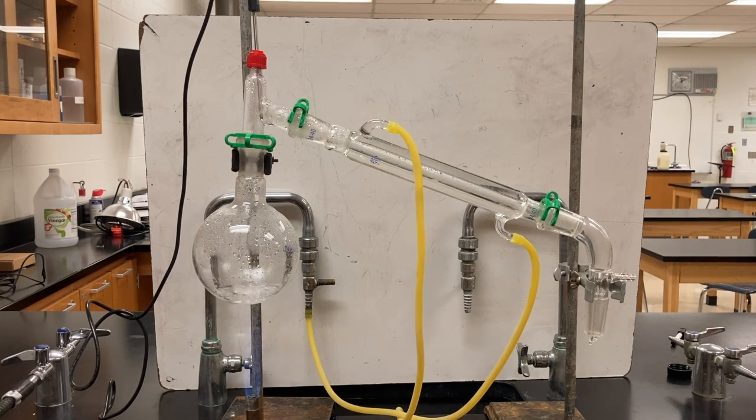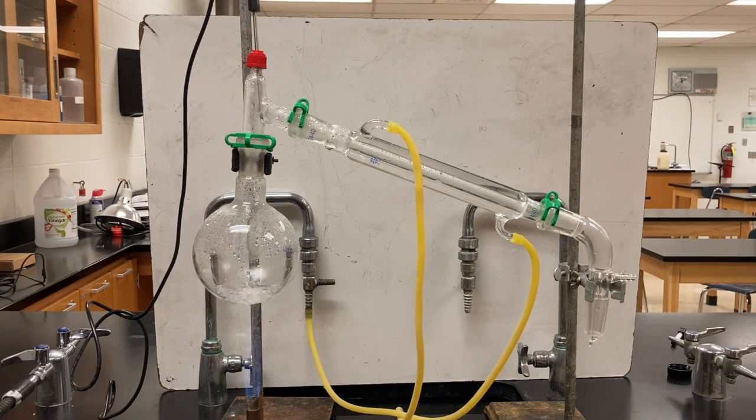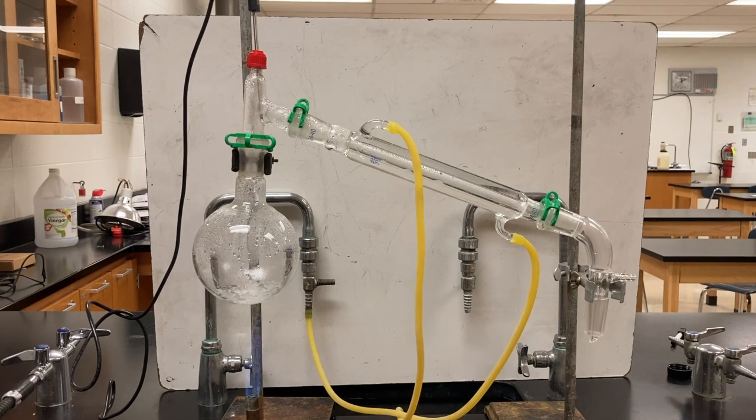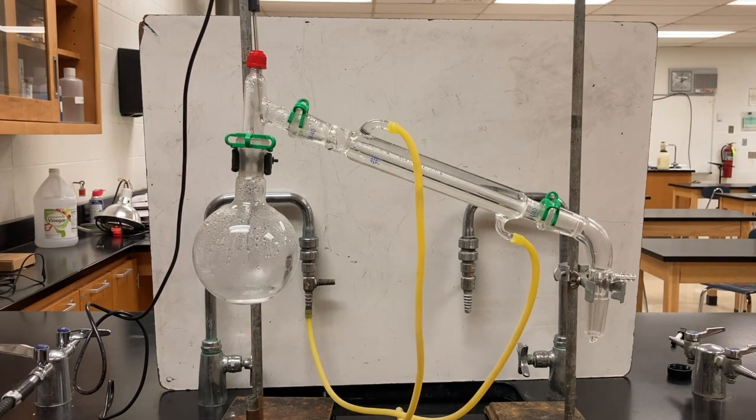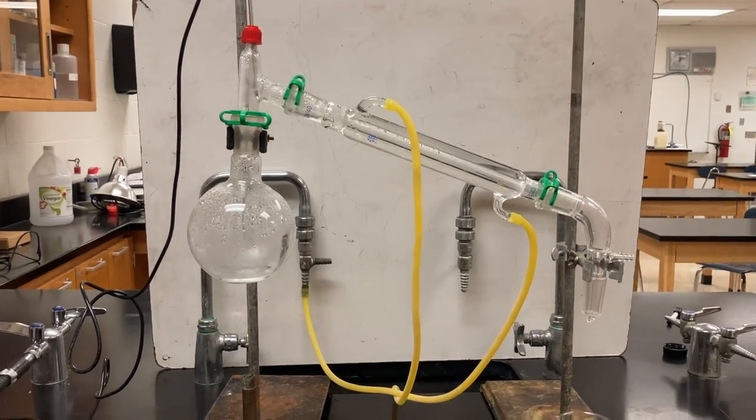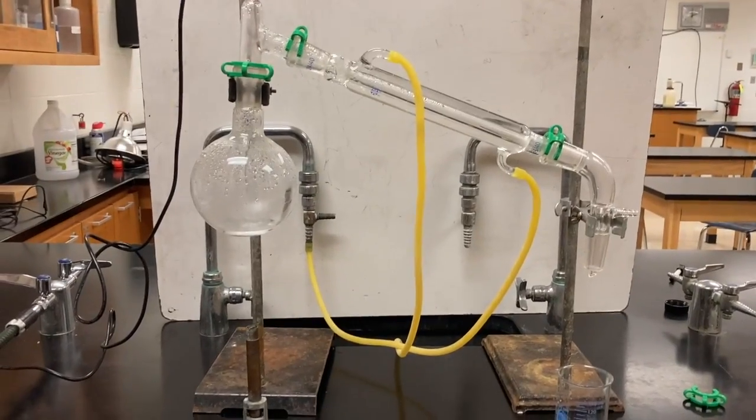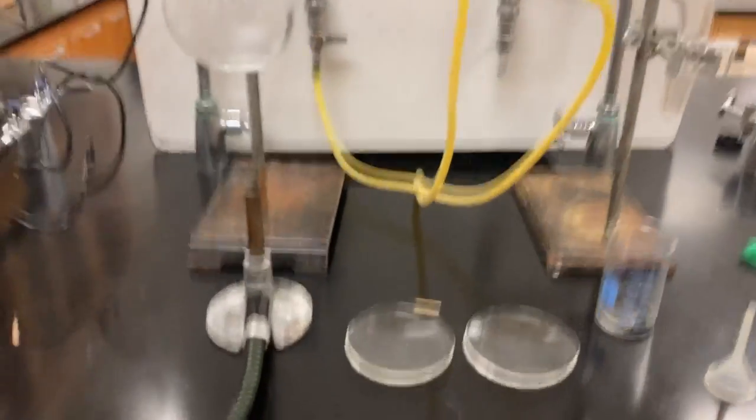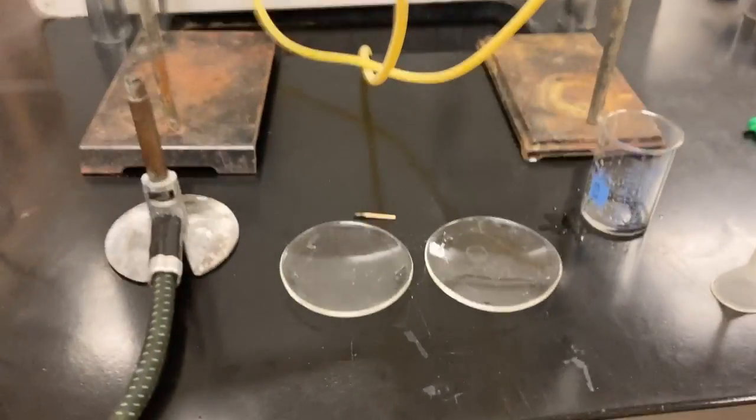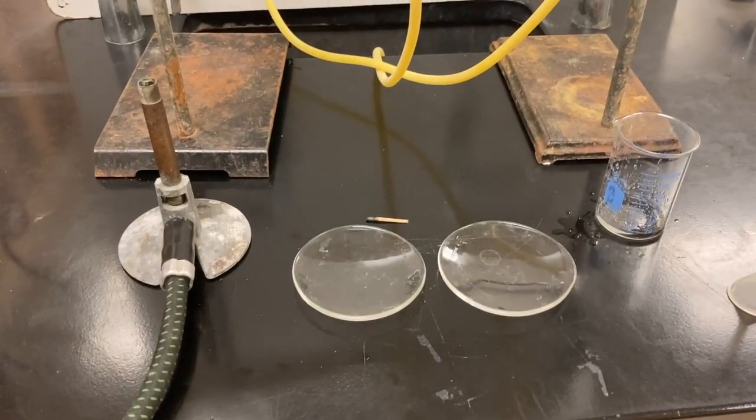We'll do a test to be sure. At this point, I'm going to stop the distillation process because I think separation is probably pretty complete. So I've turned off the burner. And now let's focus in on these two watch glasses that I put on the table here. So these are just kind of shallow dishes.